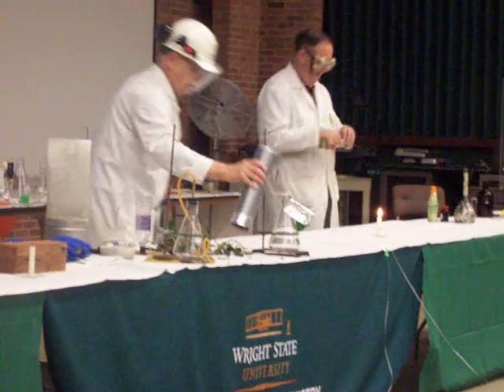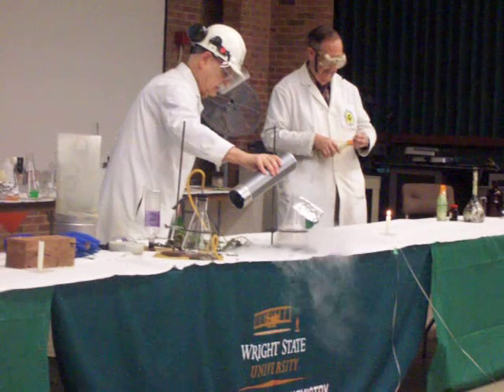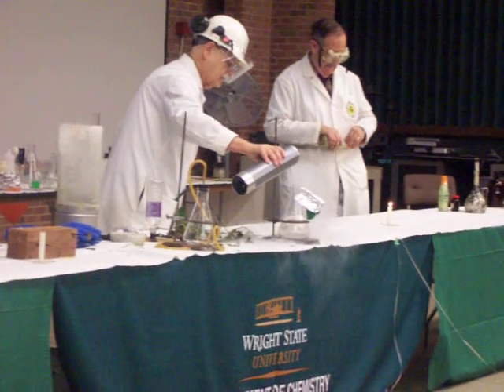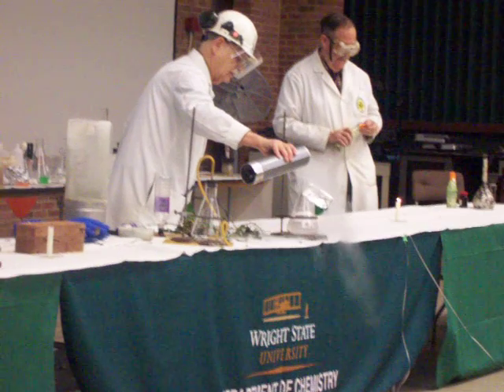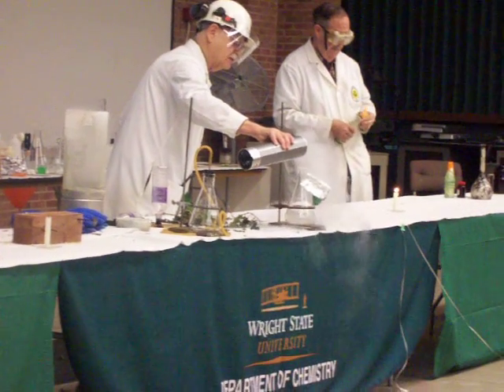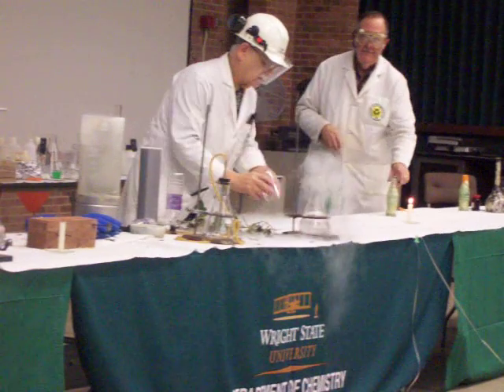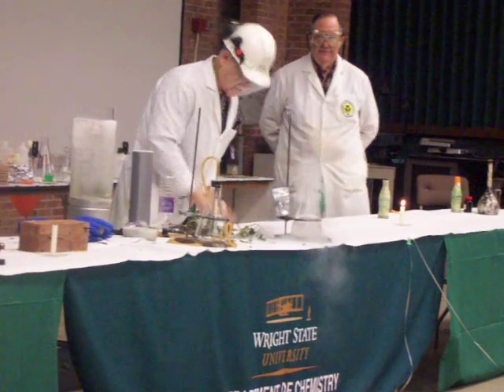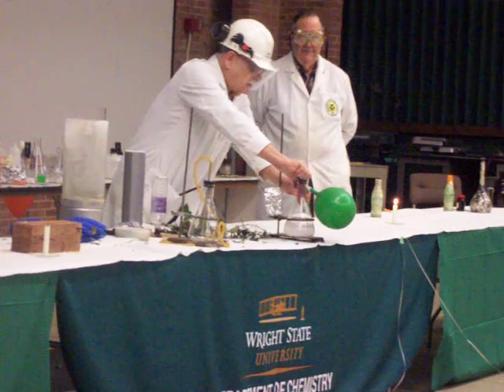I pour a great deal of liquid nitrogen into that glass, and when I get enough liquid nitrogen into the glass — and that appears to be about enough — I'll take the aluminum foil off and jam the rubber stopper in.